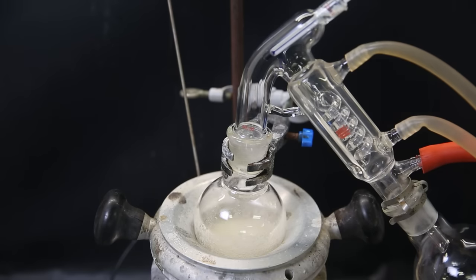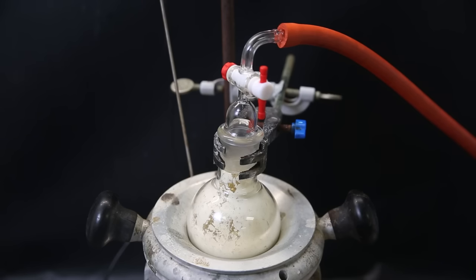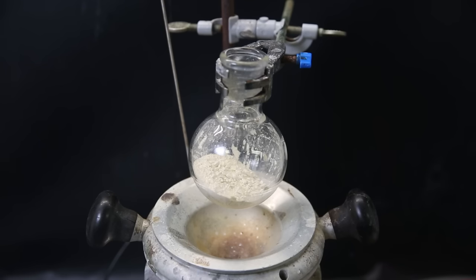I then set it up for distillation again to remove all the solvent and get a dry powder. When it looks dry, I remove the short path and attach a gas adapter instead to pull a vacuum directly so that it dries out even more. When that's done, all the solid comes loose easily, and I am left with a powder that contains the product.